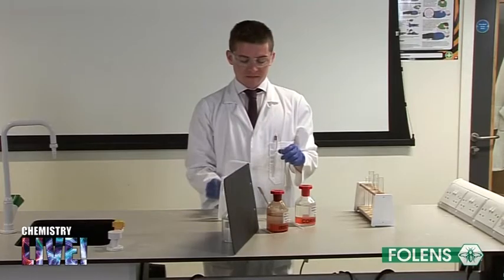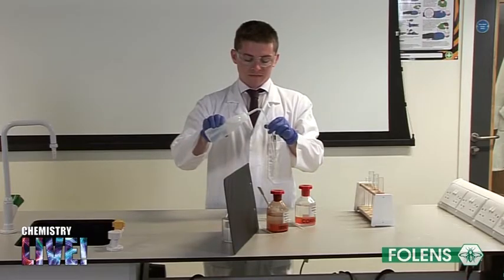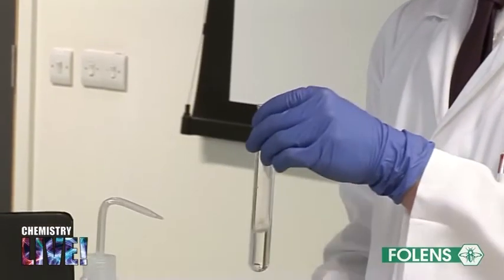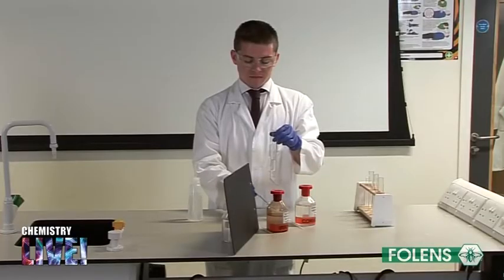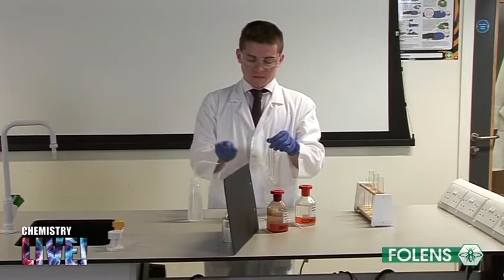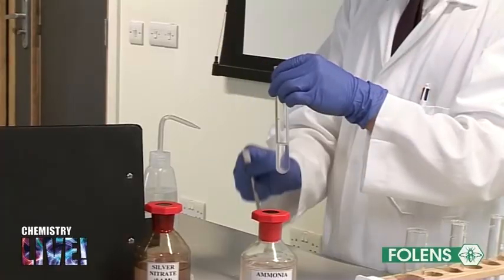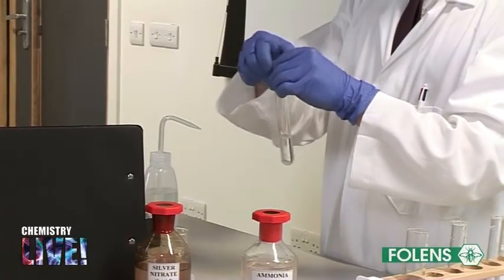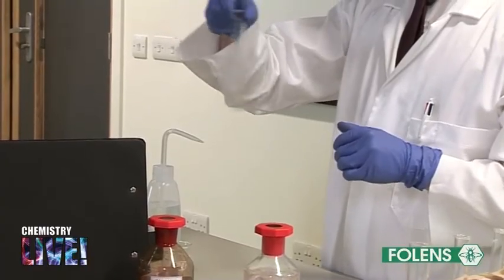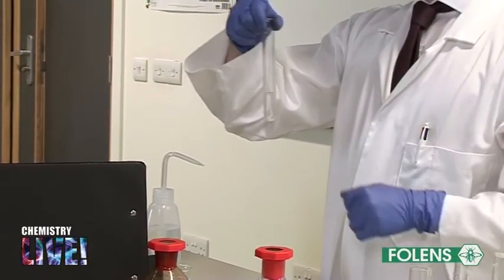Using a wash bottle of deionized water, fill a test tube to about one quarter of its capacity with deionized water. Add a small amount of chloride salt — a few crystals are sufficient — to the water. Shake the test tube to help the salt dissolve. A clear solution should be obtained.